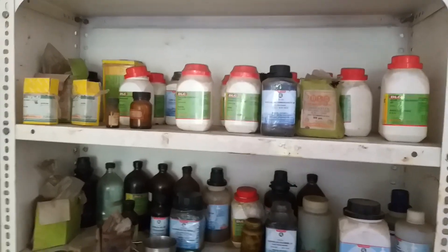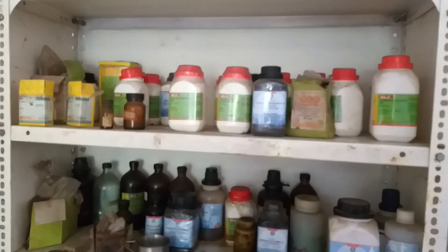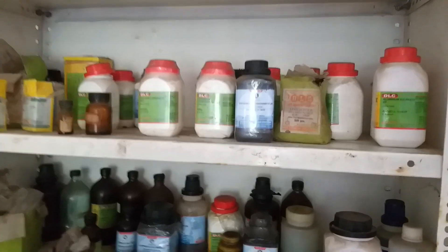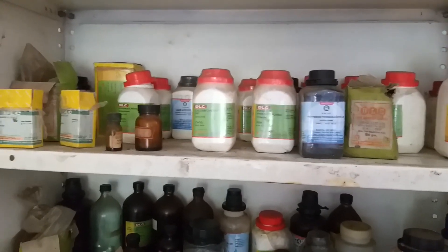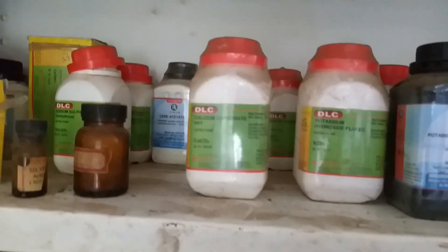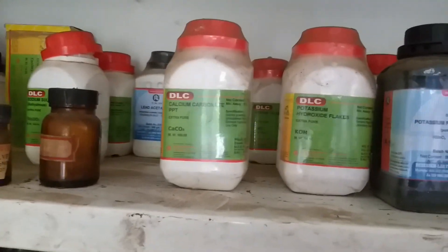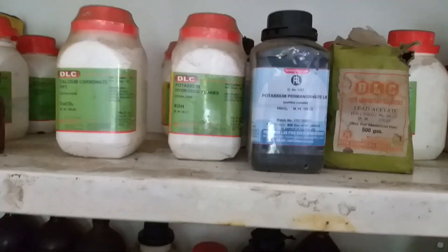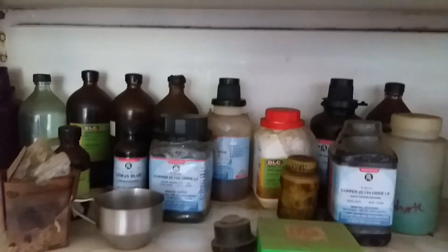We have to observe some apparatus and chemicals. This is calcium carbonate, this is potassium hydroxide, and some other chemicals — potassium permanganate and other chemicals are there in the laboratory.